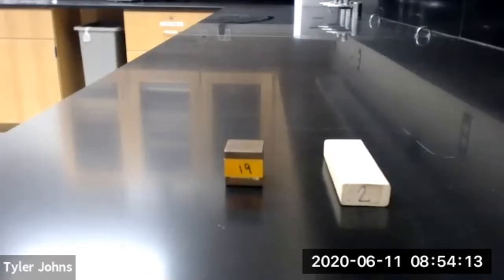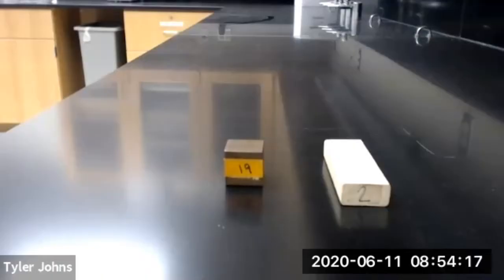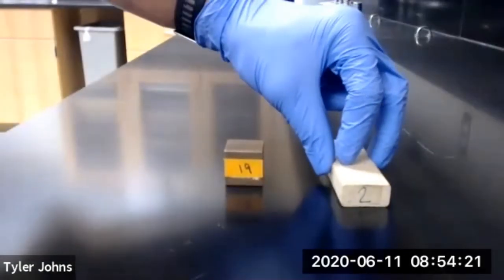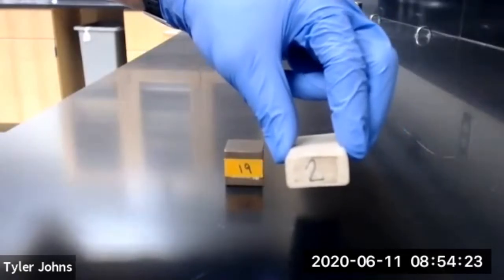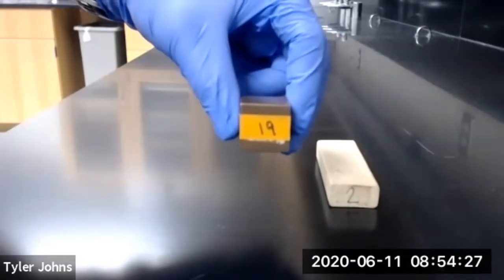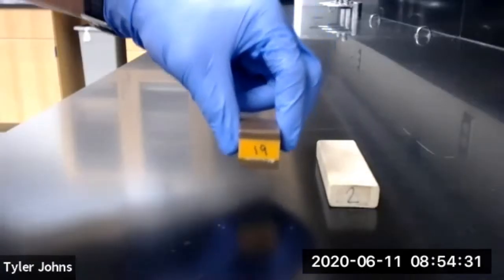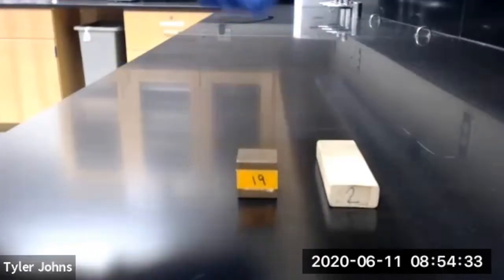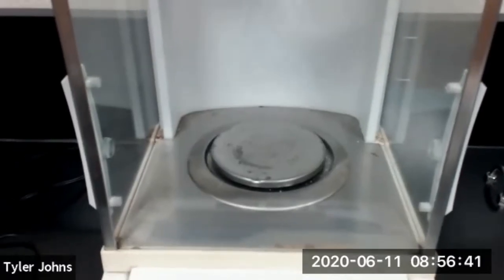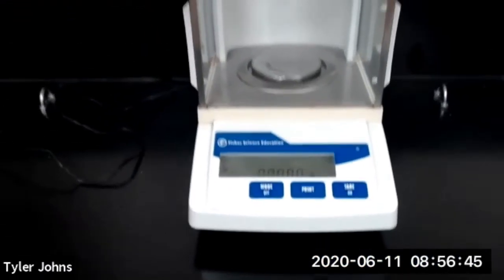For part one of this experiment, we're going to be weighing and determining the mass of two objects. Our first object will be this wooden block labeled number two, and our second object will be this copper cube labeled number 19. The first balance we're going to use is an analytical balance — and this is our analytical balance.